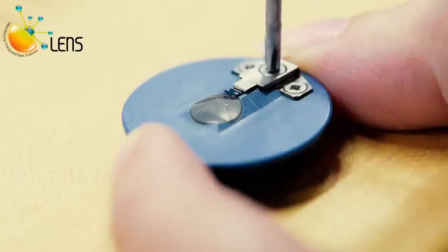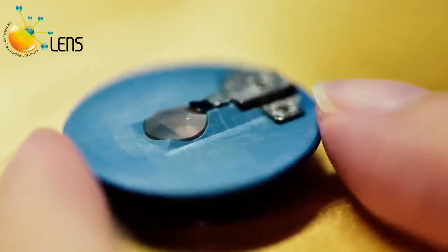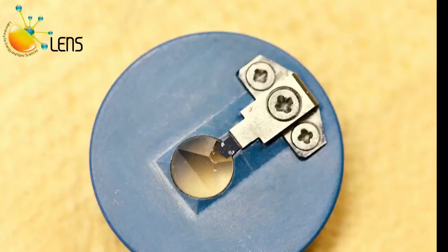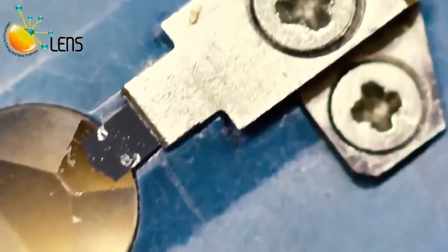Tighten the screw in the center of the stainless steel tongue assembly. Position cantilevers so that they are centered, more or less, in the trapezoidal shaped quartz optical window as shown.